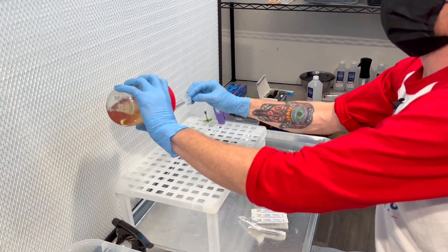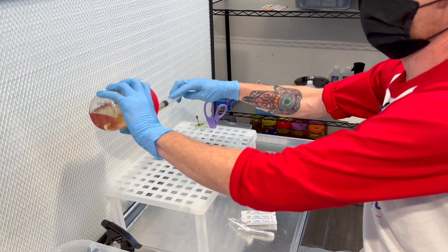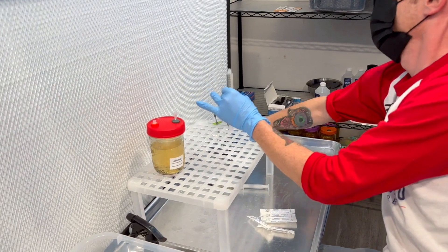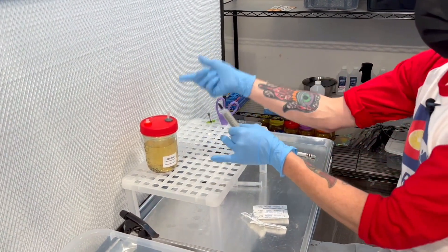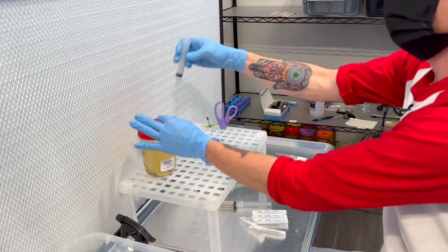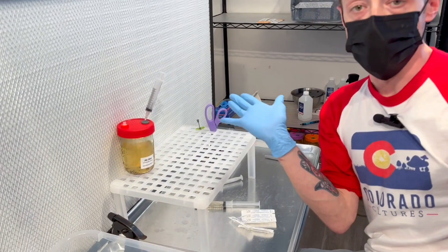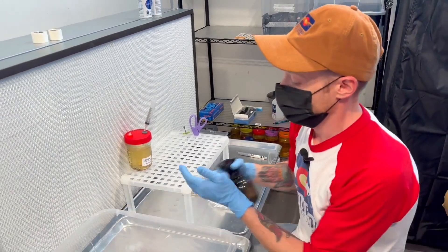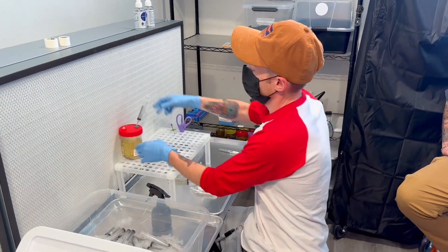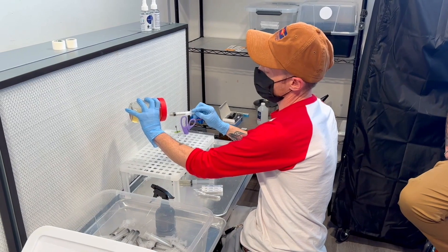Now let's say you're doing this and you have an emergency in your lab and you have to go do something. Well, you can see you have an open hole here. You can basically just take one of your syringes, put it on there, go do what you need to do, come back, get clean again, and get right back to work. That way you're not wasting your time or wasting any product.